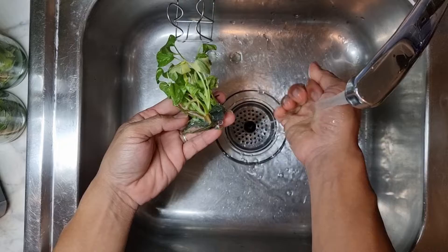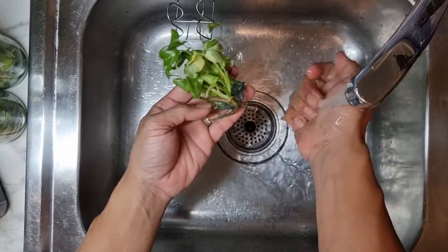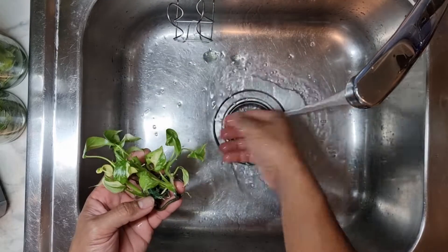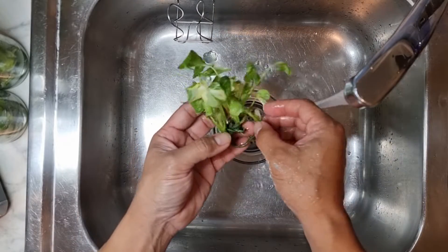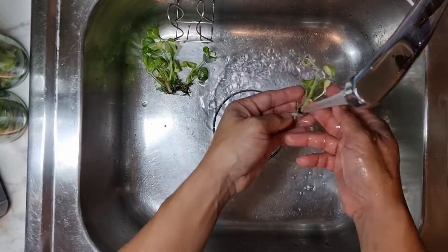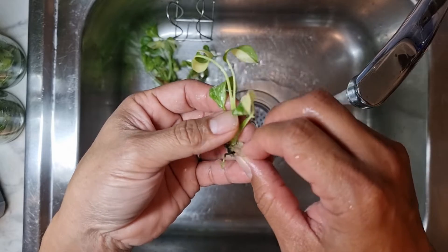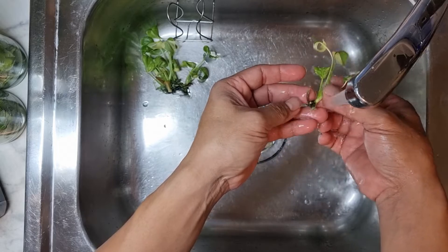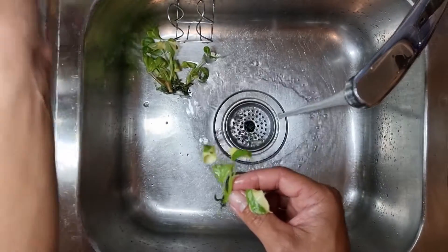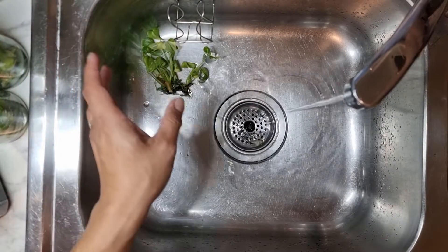Put that flask aside and focus on this one. There's a lot of roots in there. I like to give it a little bit of warmth - not really super warm, but just for my hands as well. I cleaned the sink before starting, with soap and water, so you can put the plants down on it. This one here is an old PDO, looks like it's going to die soon enough anyway, so take that off and that's a pretty nice clean four leaves there.